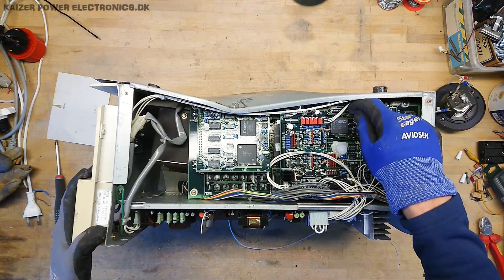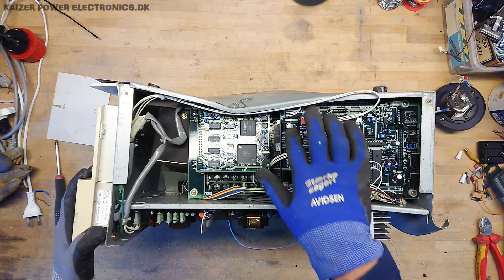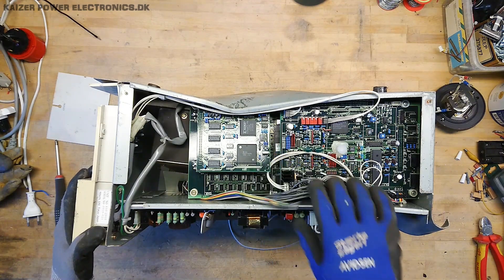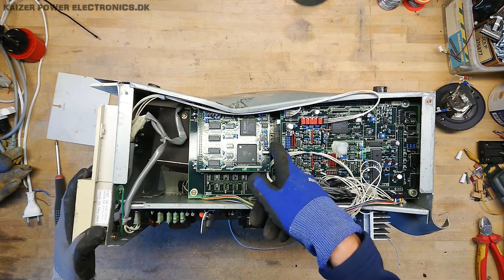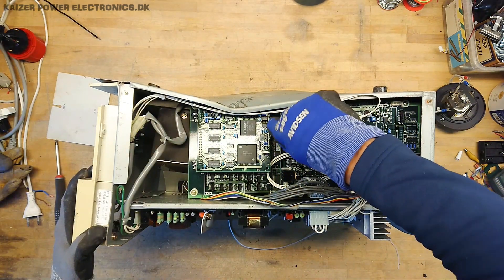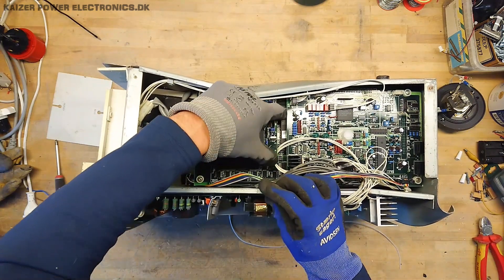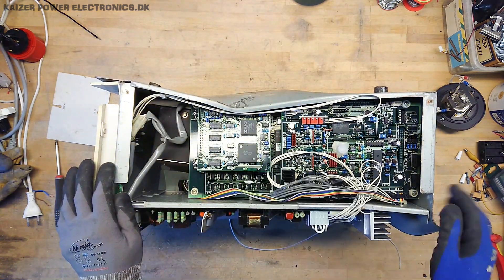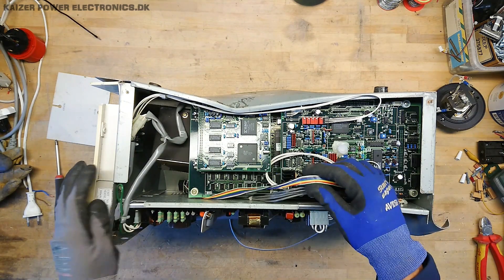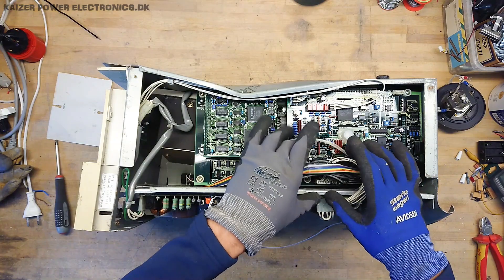The control electronics are driven by Xilinx FPGAs — two of them — and there seems to be a large board underneath. It looks pretty unharmed, but I can see it has a decapped EEPROM down here. Let's get some of this taken apart and see what nice parts we can find inside.